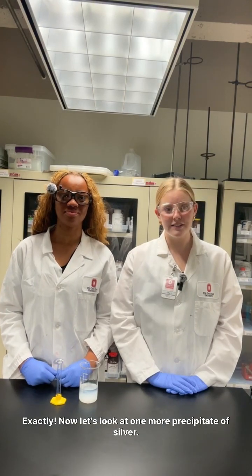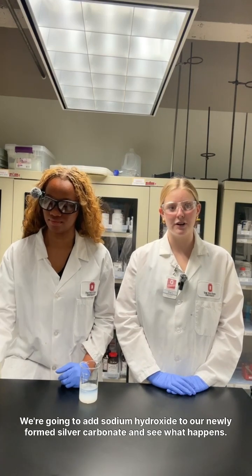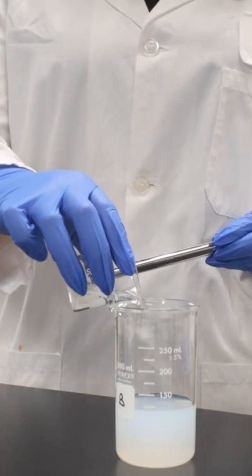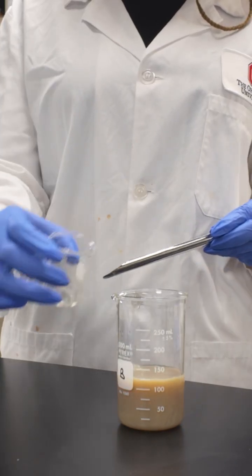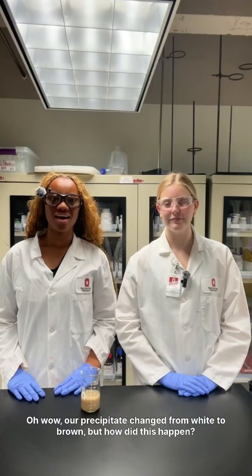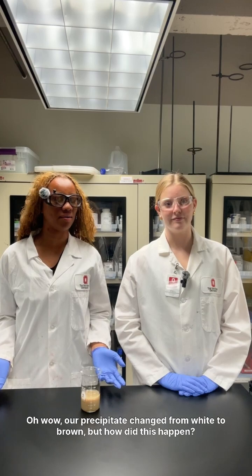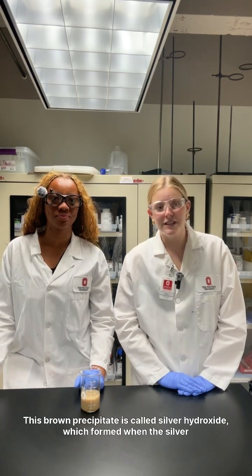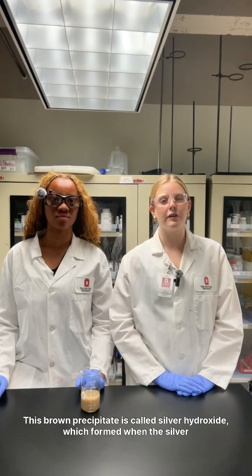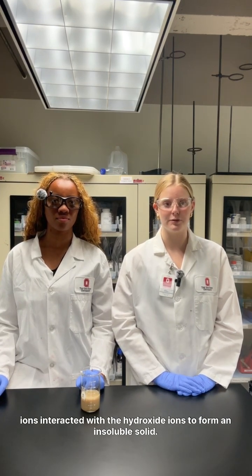Exactly. Now let's look at one more precipitate of silver. We're going to add sodium hydroxide to our newly formed silver carbonate and see what happens. Oh wow, our precipitate changed from white to brown. But how did this happen? This brown precipitate is called silver hydroxide, which formed when the silver ions interacted with the hydroxide ions to form an insoluble solid.